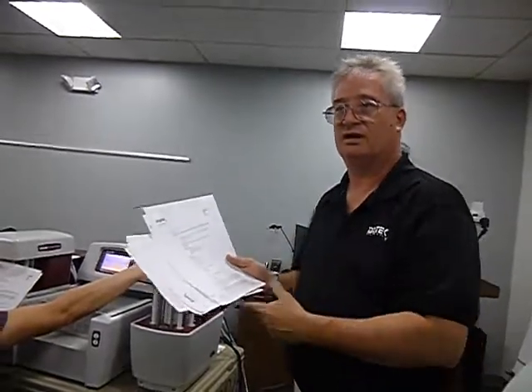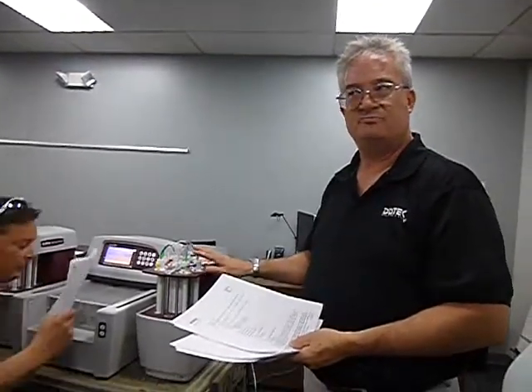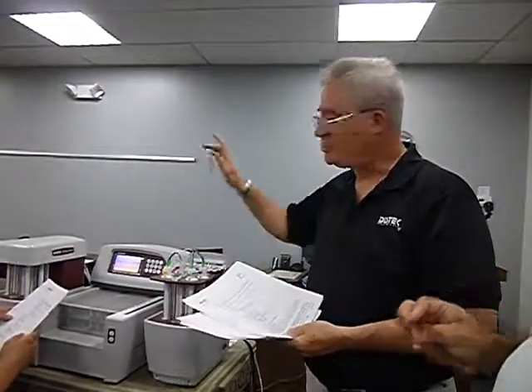There wasn't enough delay. Now with the wider ID lines, the newer versions, and I think it's anything over 3 point something, 3.05 or something, they're already preset at 3, 3.5. You usually don't ever have to change them anymore. The older versions and all the DSs, you had to go in there and change them, because at 25 mils a minute it's too fast, the lines were thinner. And even if you put new lines on it, you still have to change that, because the new lines are automatically now 3.5, 3 and 3.5. So you literally have to go in and change both of those.